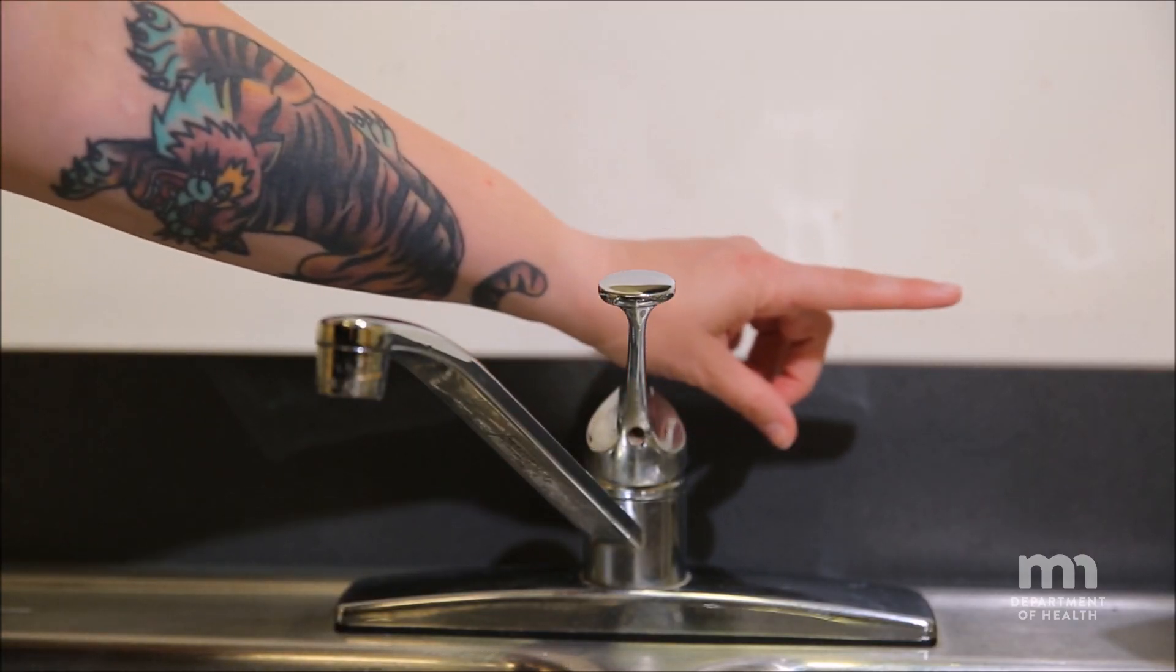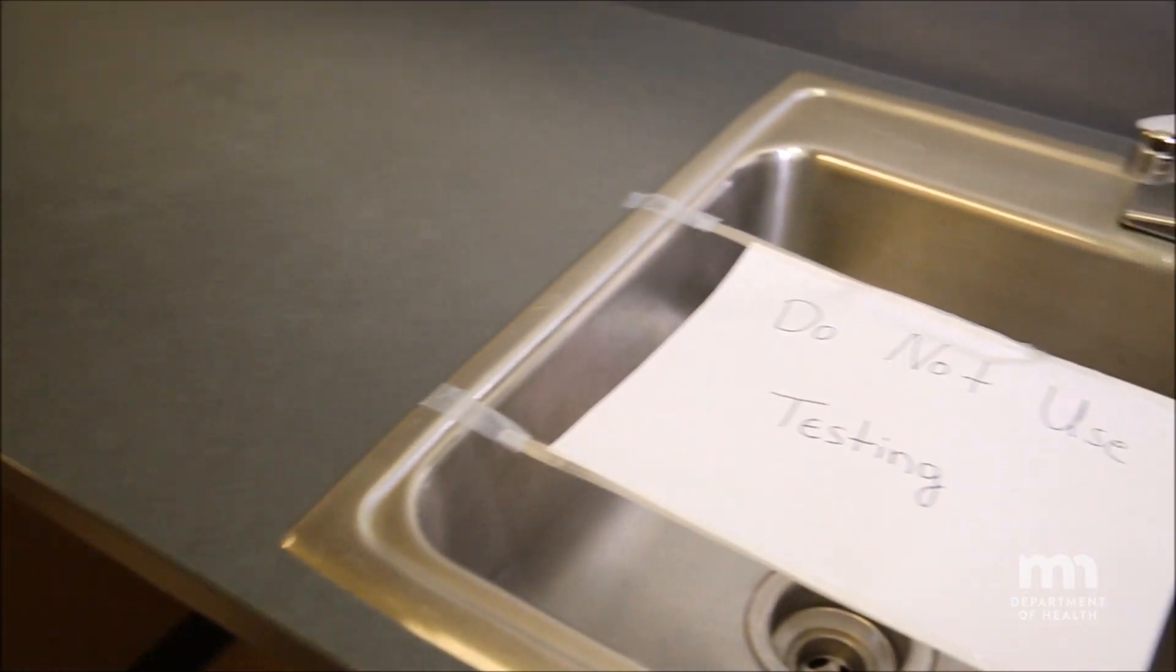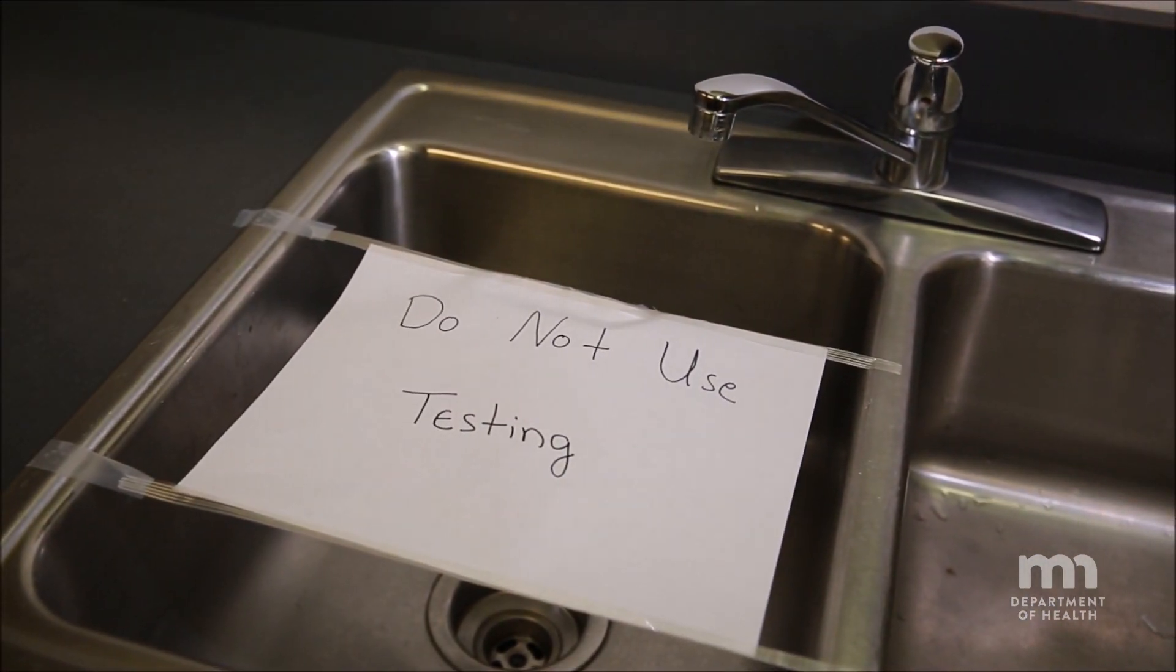Take samples from the cold water tap of a faucet that is used regularly, but remember not to use the faucet for 6-12 hours before you take the sample.